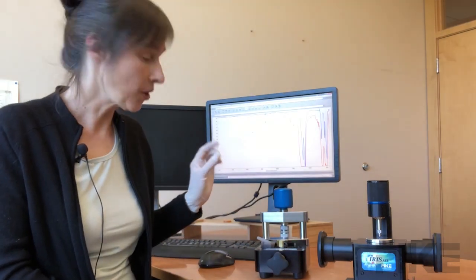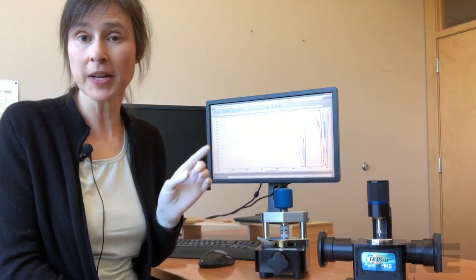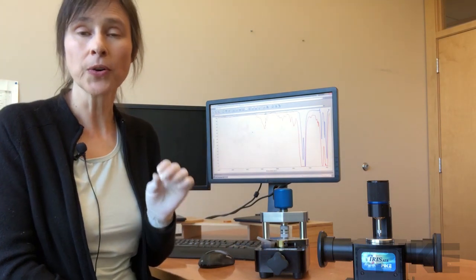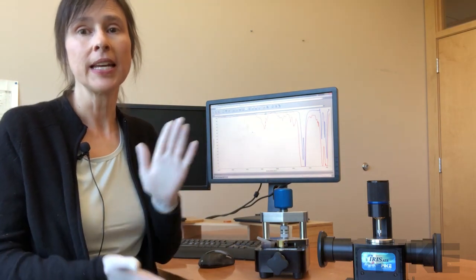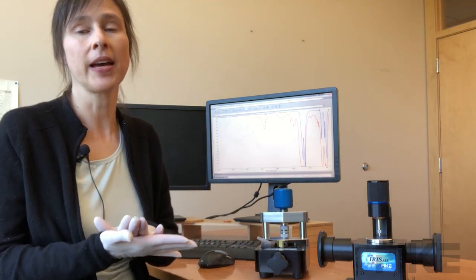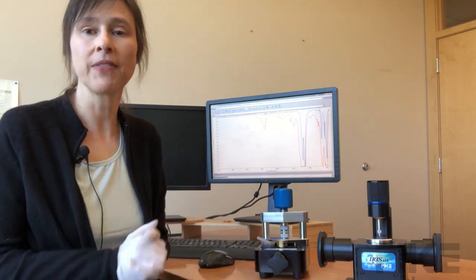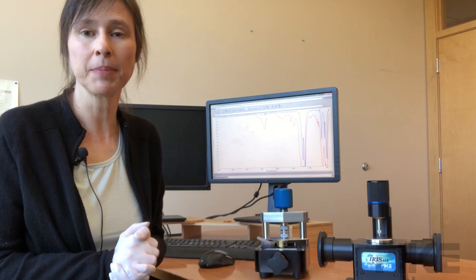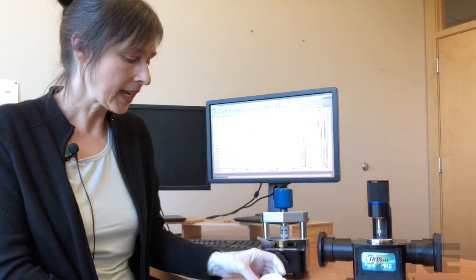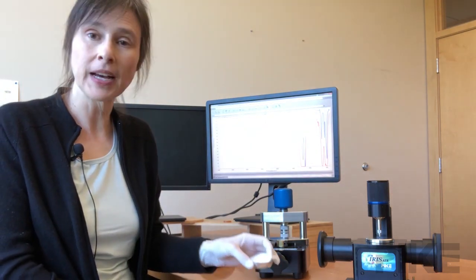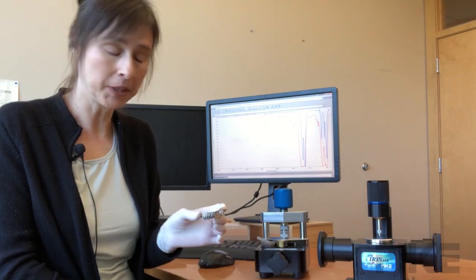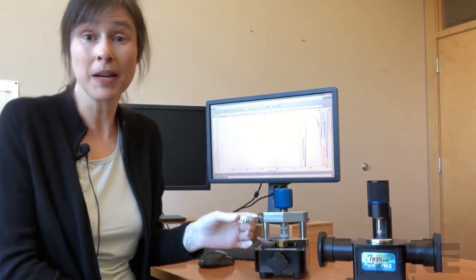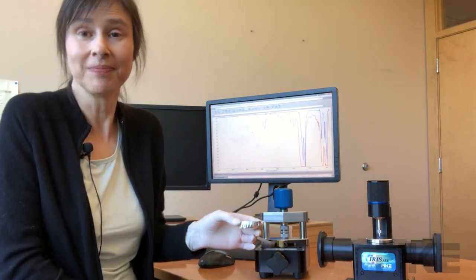Before I let you go, I just wanted to mention most polymers are going to need heat to make that film, and we do have the heated Pike platens so that would be an option. But in the case of this Teflon fluoropolymer, it flows by itself just by applying pressure.